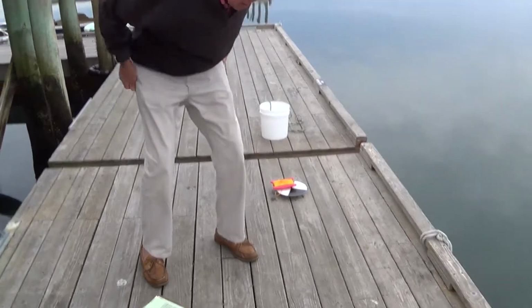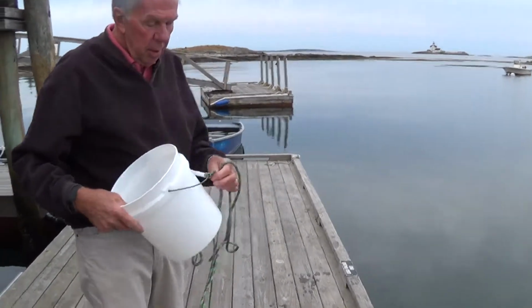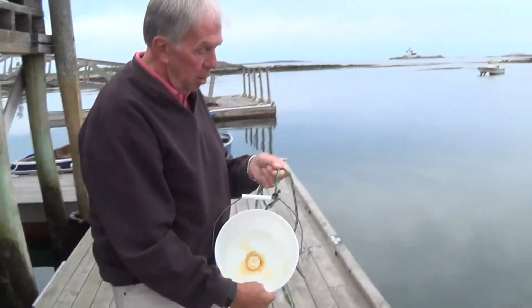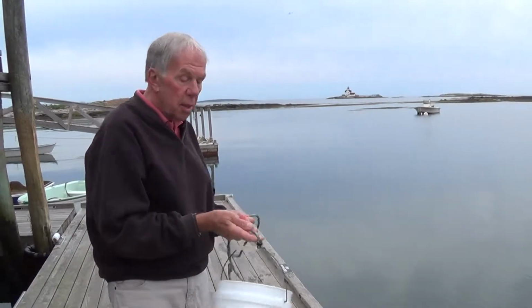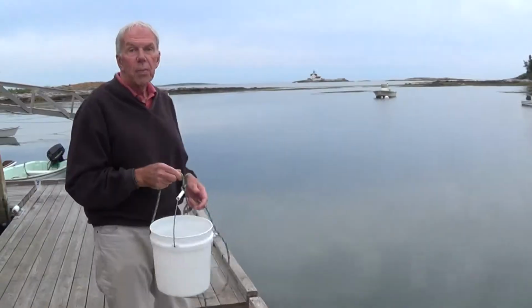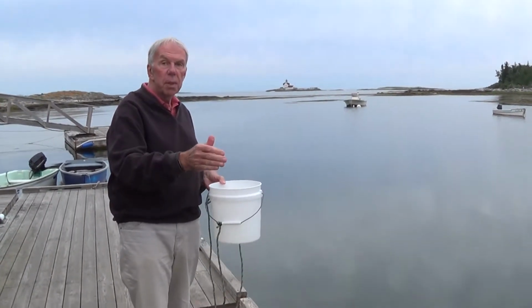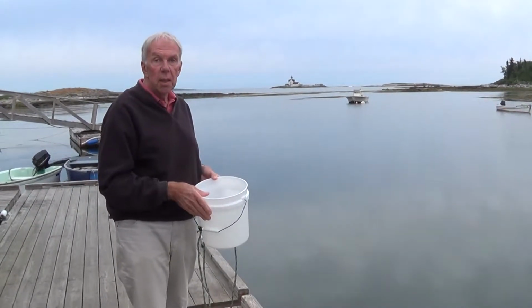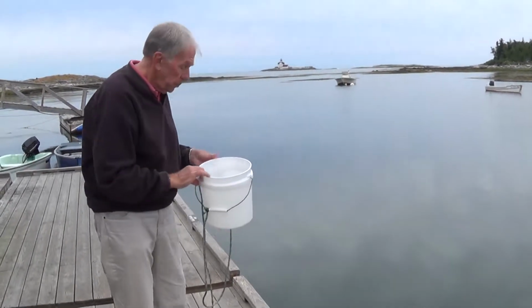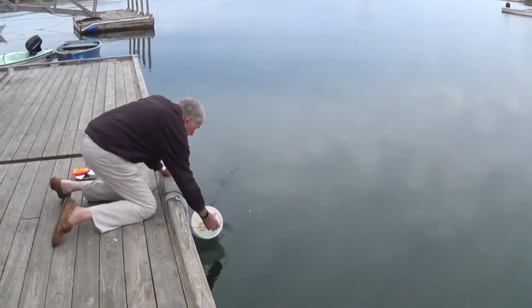So the next thing we're going to do is rinse out the bucket. Here again, it's always a good idea to make sure that this is tied securely. You want to rinse out the bucket 3 times and then fill it up and use that as a basis to take readings with the instruments. So we're going to rinse the bucket in one location and then move upstream and take the sample of water from a distance of 4, 5, 6 feet away so that you don't have any contamination. All right. So this is just simply rinsing it out.